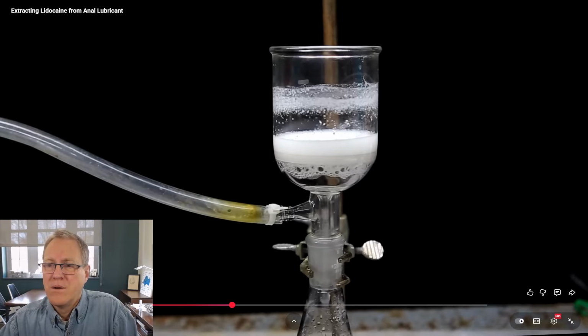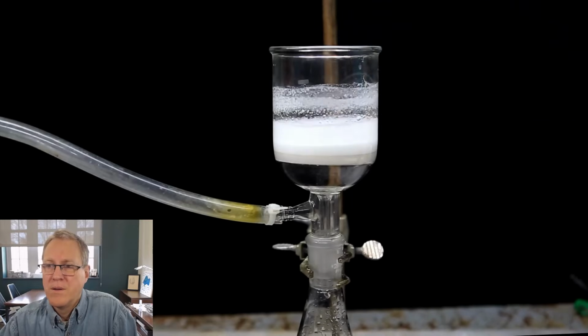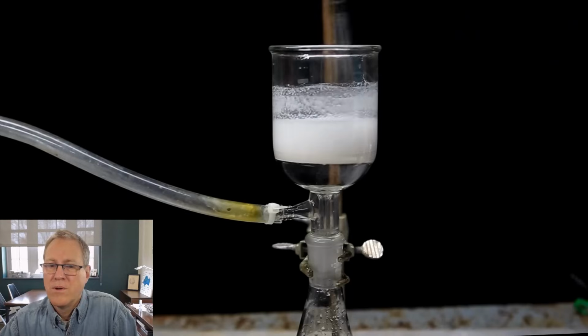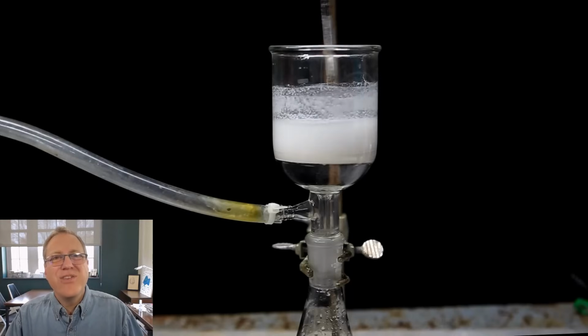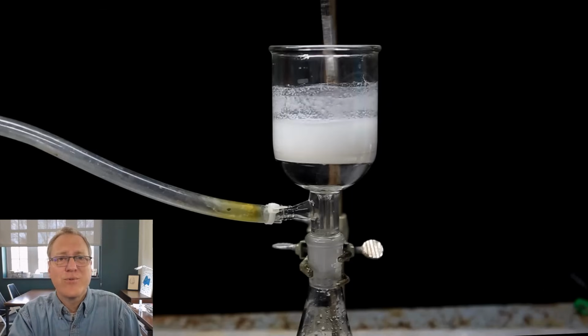Eventually, most of the water is gone, and we're left with the lidocaine at the bottom, but it's a little gooey. To get rid of the gooiness, we just wash the lidocaine a few times with some distilled water. That gooiness is the thickening agent, and that is a cellulose product. It's water soluble, and so he's just rinsing that thickening agent, any residual that's on his solid, to get it off there. Rinse that with water. And that should carry that thickening agent into his receiver flask and get it away from his lidocaine product in the top of the funnel.